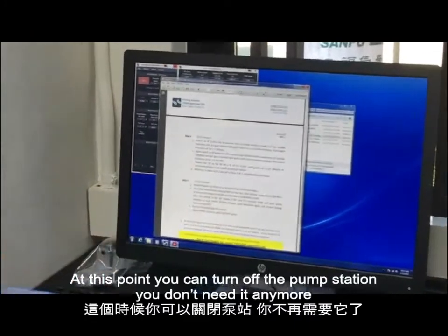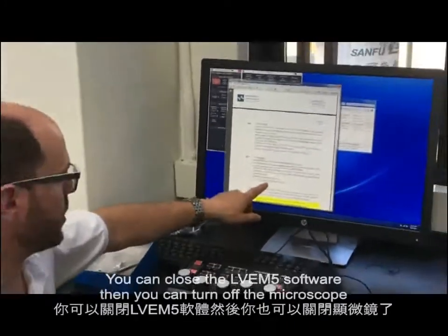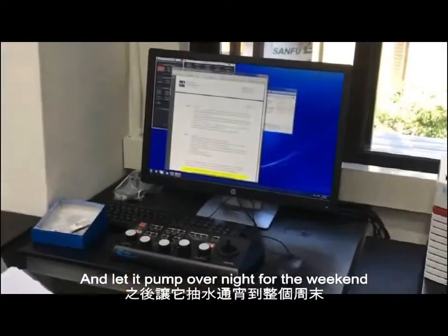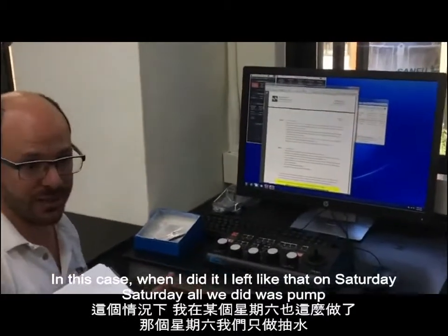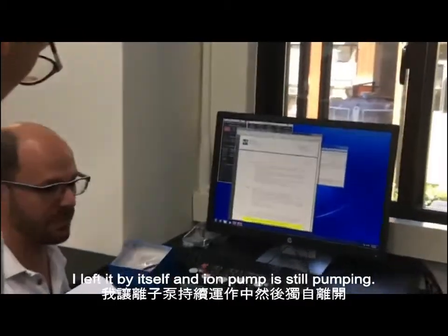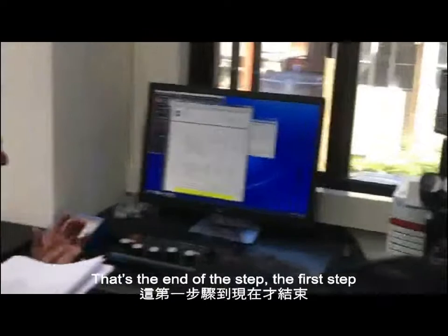At this point, you can turn off the pump station. You don't need it anymore. You can close the LVEM software and you can turn off the microscope and let it pump overnight for the weekend. In this case, when I did it, I left it like that on Saturday. Saturday, all we did was pump. I left it by itself and the ion pumps were pumping. That's the end of the first step.